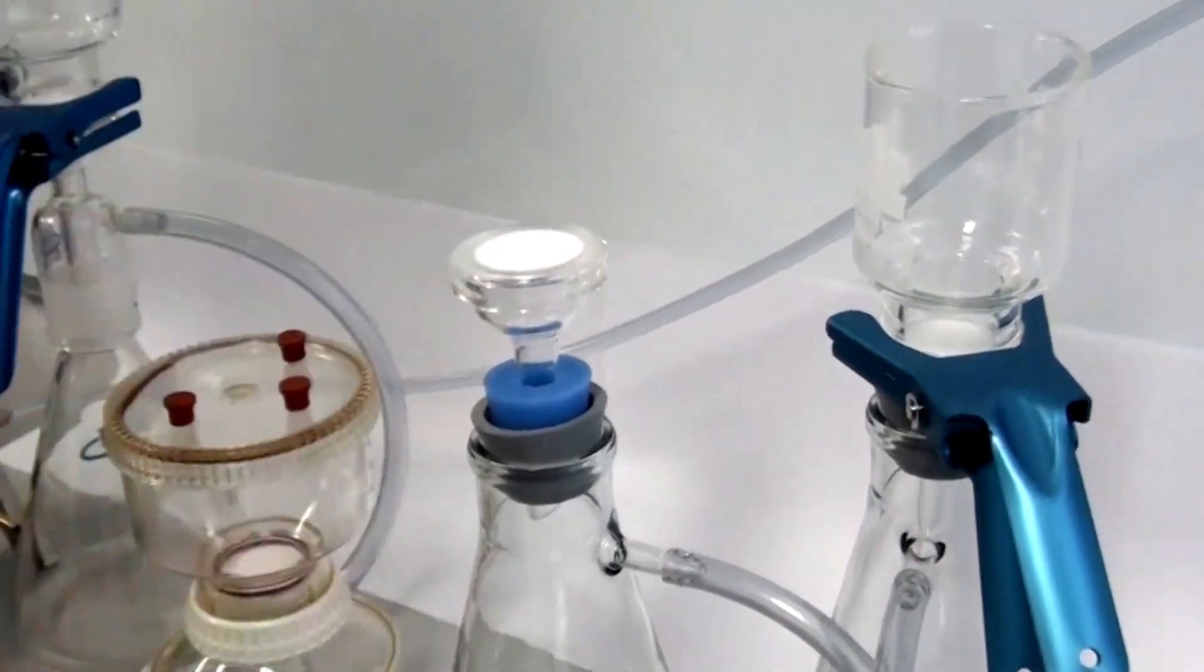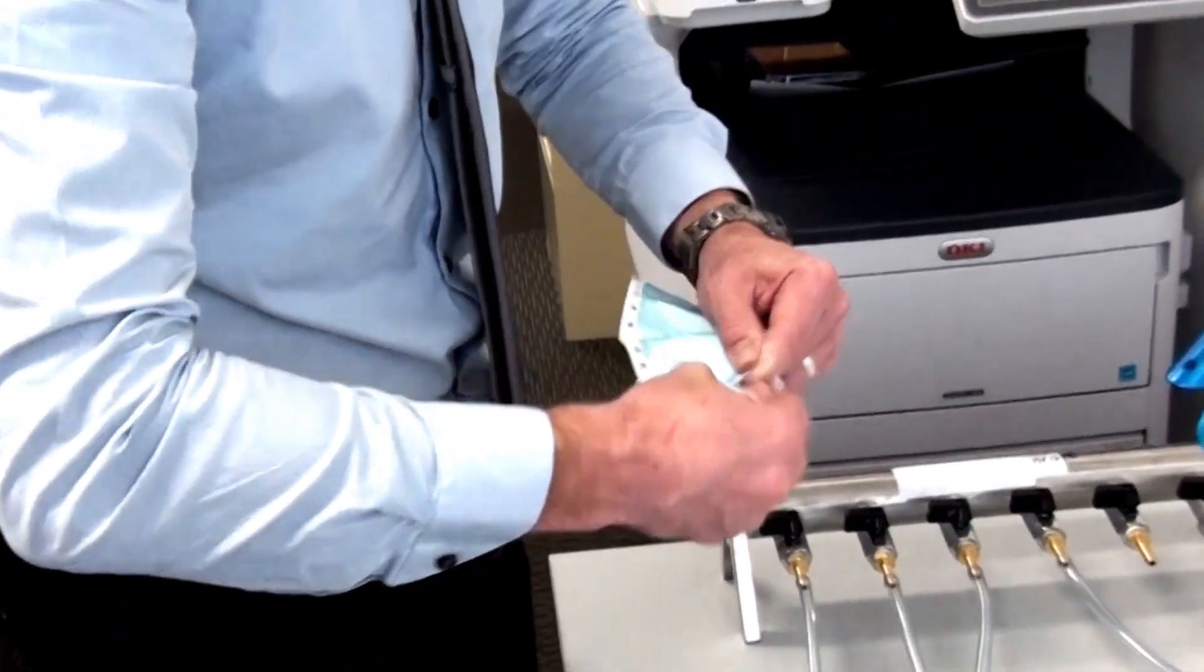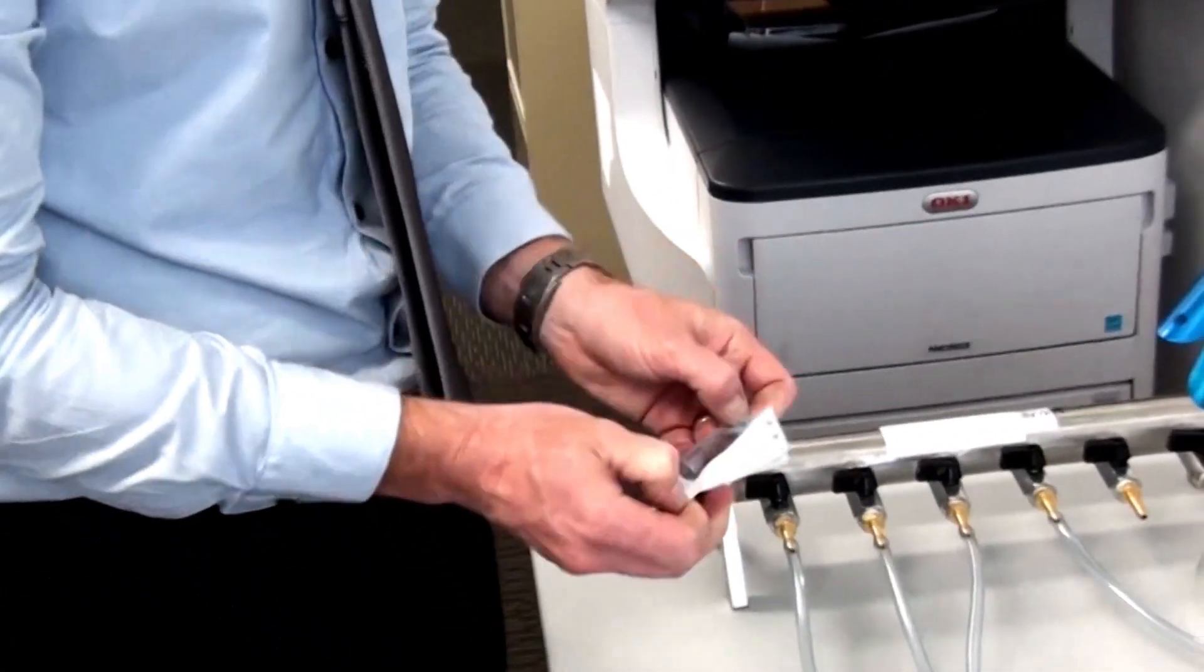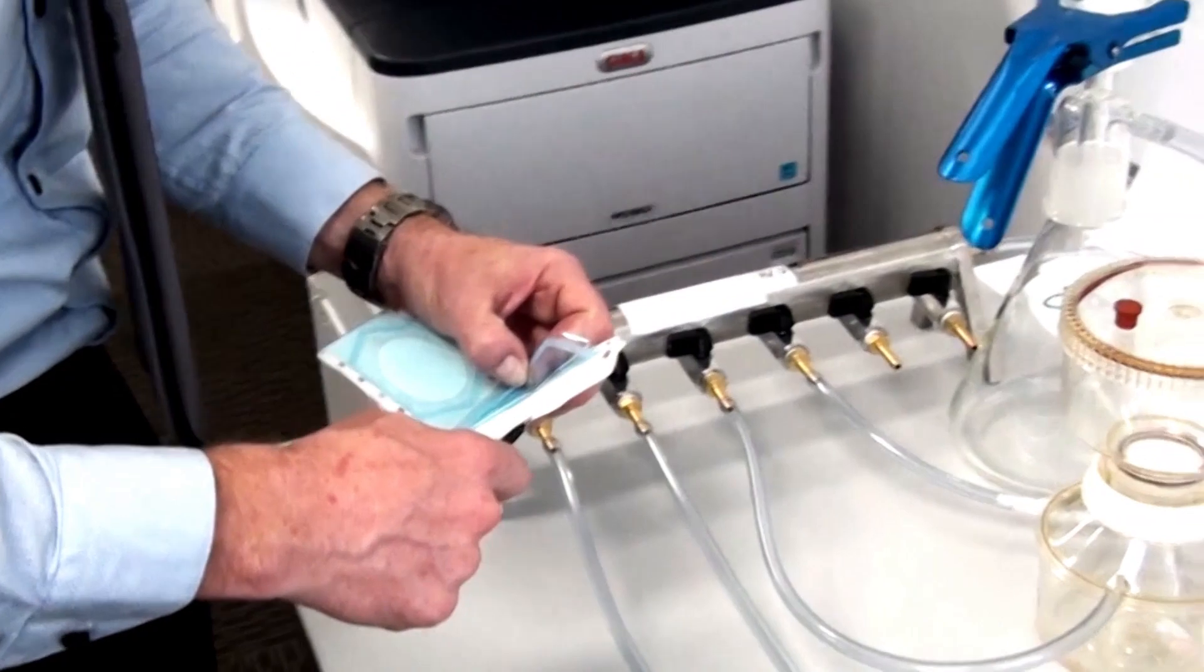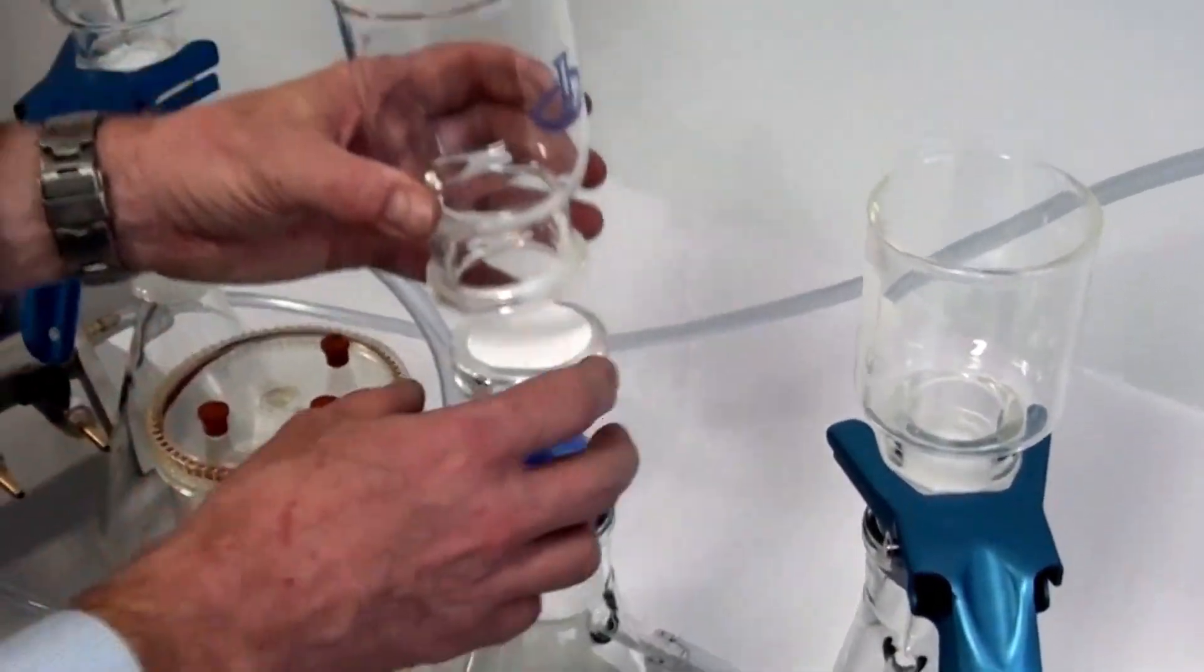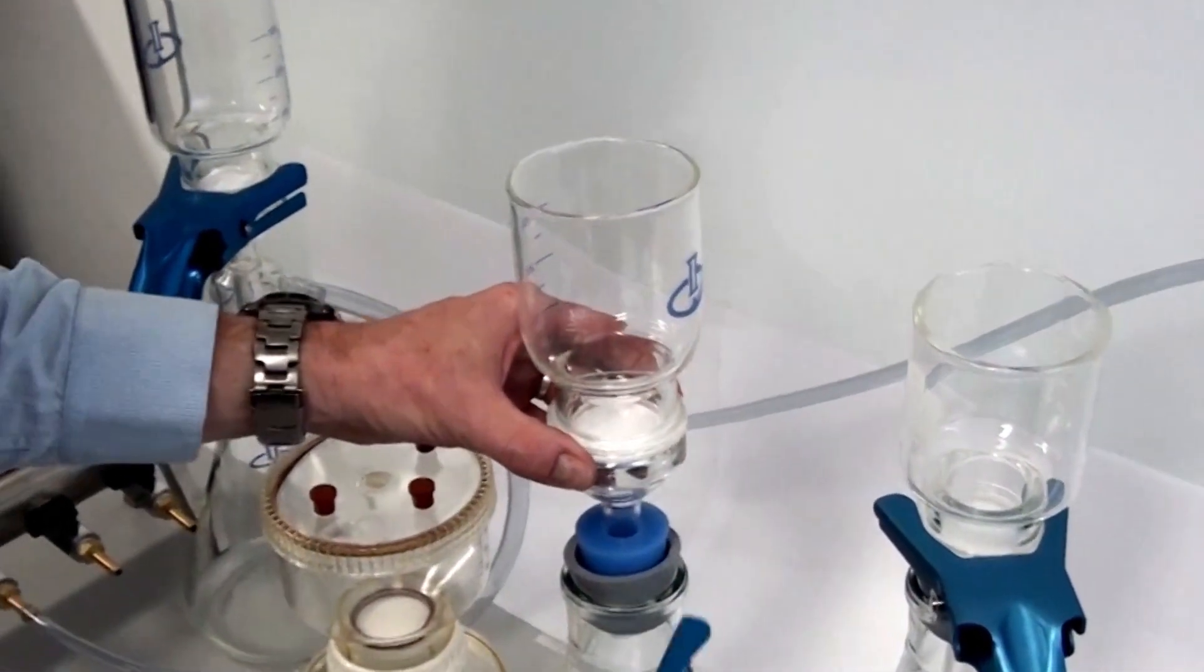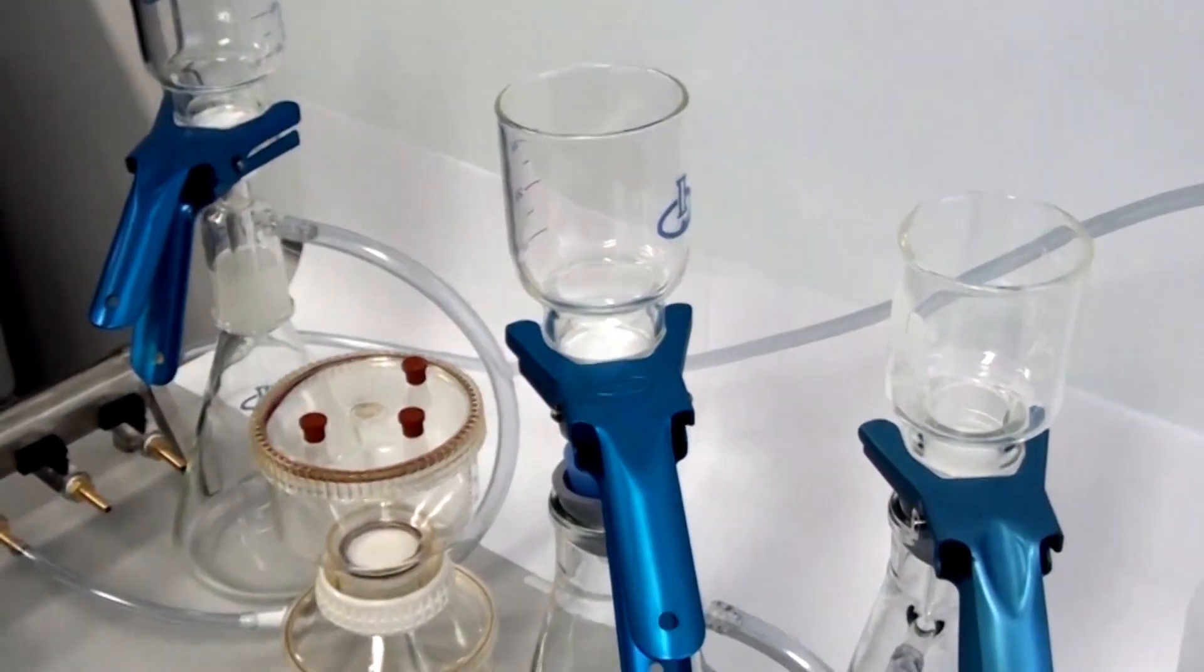Let me take that off. I'll pop a membrane on there. I think this is just a 0.45 micron membrane.